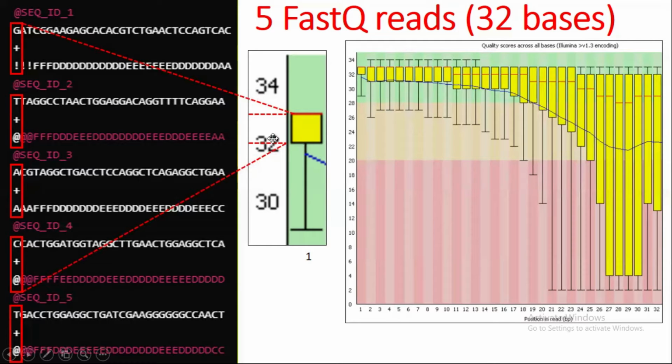We can say that more than 50% of our data is present in this region. For example, the first four bases of the first four sequence reads have their quality lying in this range, for example between 32 and 33. For the last one, its range lies between 29 and 32. Overall the quality of my first base is almost good. It lies between 29 and 33, so it is present in the green region. You can interpret the other positions the same way. This red line is the median, and this blue line is also something I will now show you.